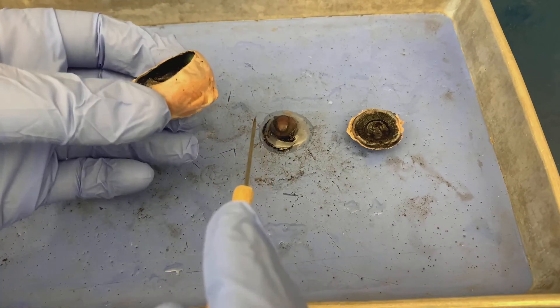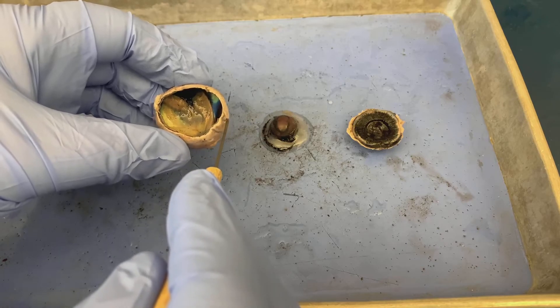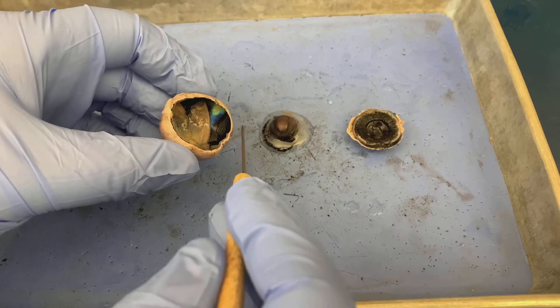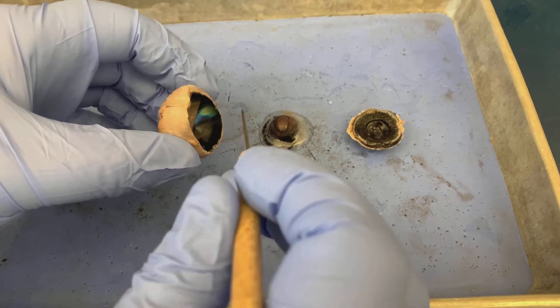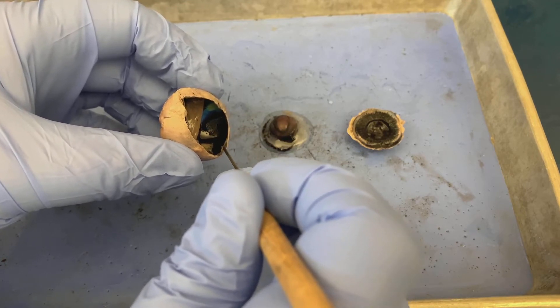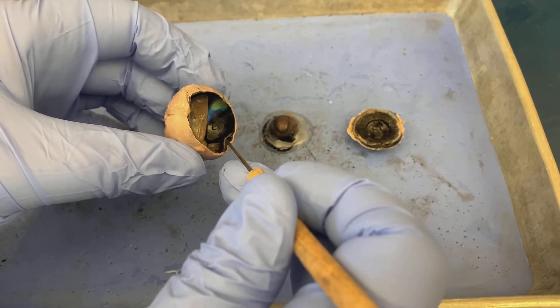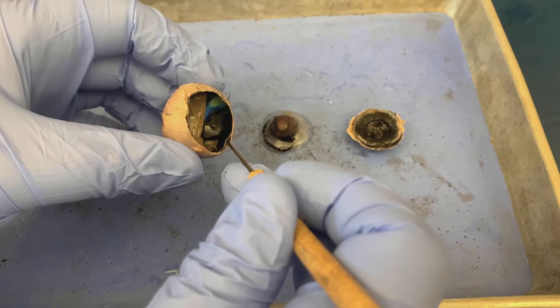Moving to the rest of the eye, mostly the posterior portion, this white layer all the way around the eye is the sclera. Working our way deep from the sclera, if I take my probe and get between that layer and this black layer that I'm lifting — that black layer is known as the choroid.